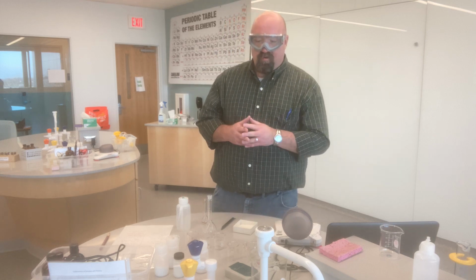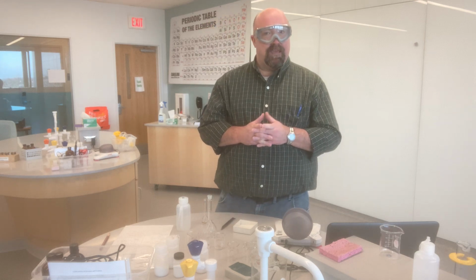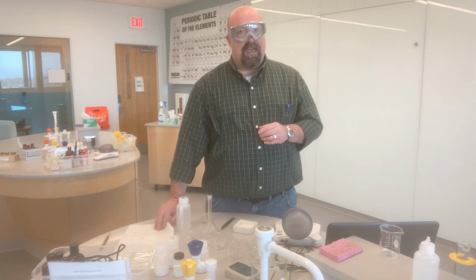Today we are looking at conductivity and pH. Those were all hopefully discussed pretty well in your pre-lab, and so we're going to go through the procedure today.